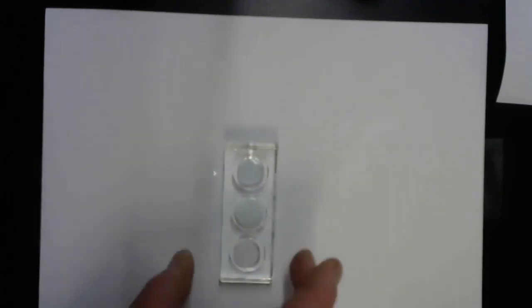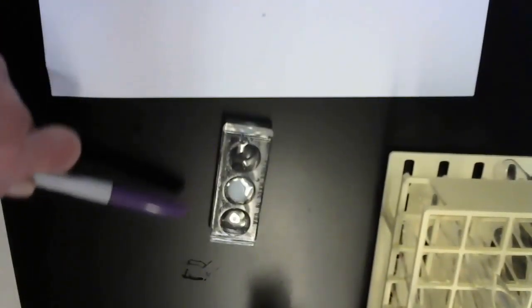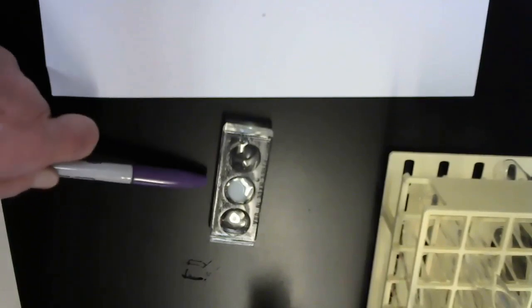And there's clearly a precipitate forming there. Although on a white background, again, it's a little tough to see. So I think what I'll do is just pull this over a little bit, and then I'm going to move my camera. Again, this was the copper sulfate, this was the barium nitrate, and this is the copper sulfate plus the barium nitrate mixed together.